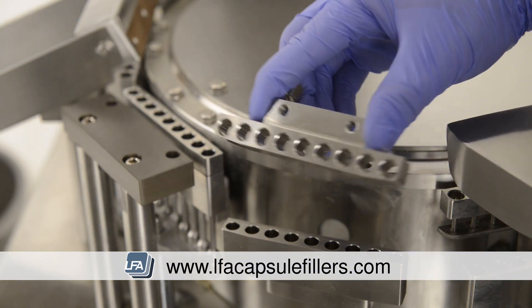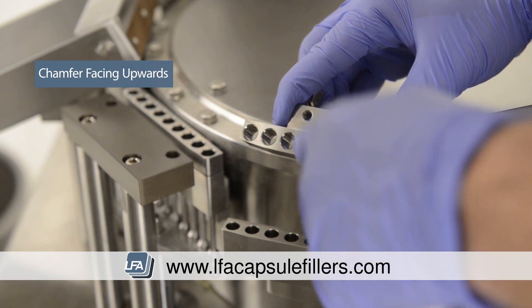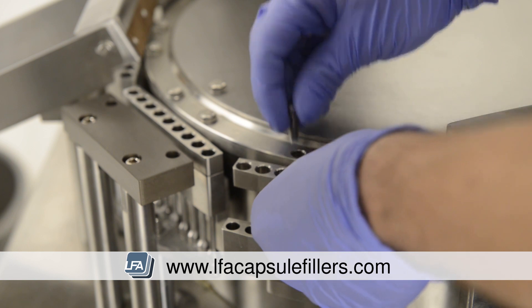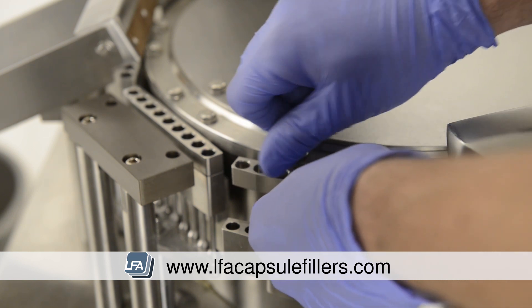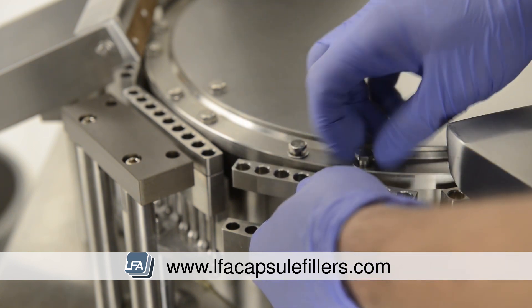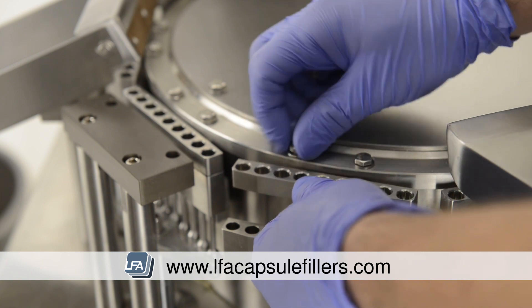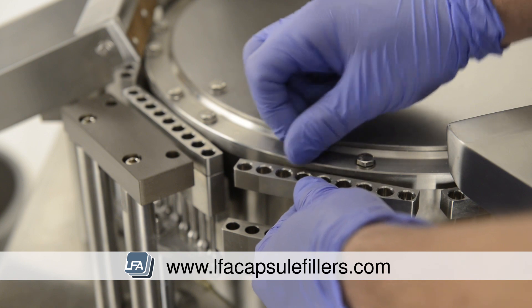Take your top section of tooling, ensure the chamfer is facing upwards, and place it under the lip of the turret. Place the bolt and nut through the top and tighten finger tight. Do the same with the other bolt and again tighten finger tight. This is very important — ensure you're still able to adjust it.